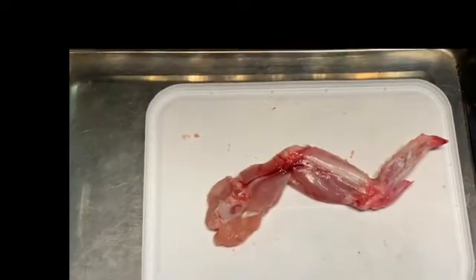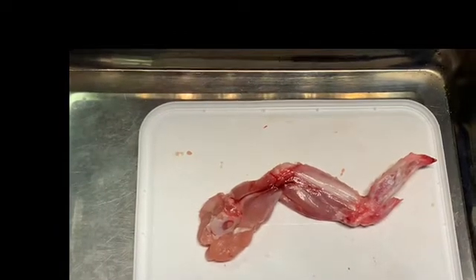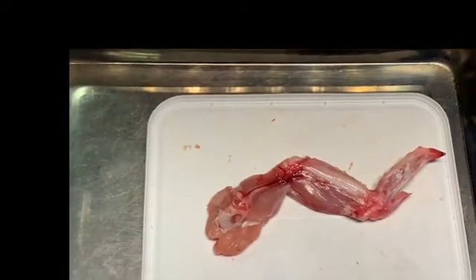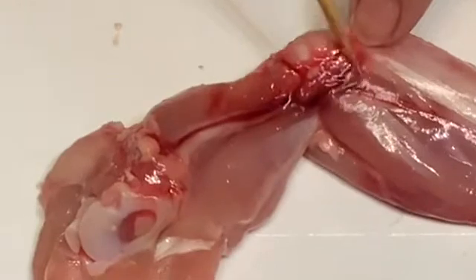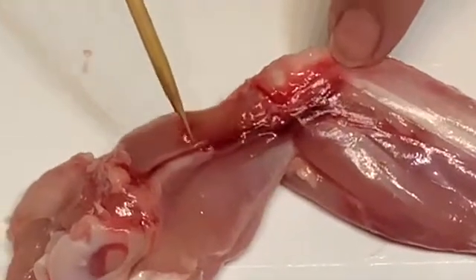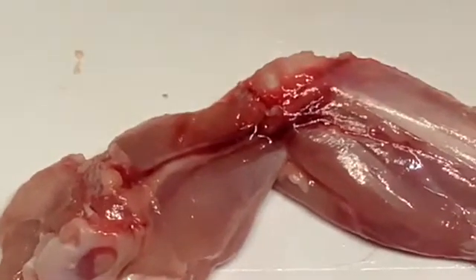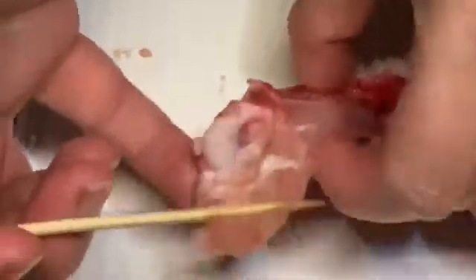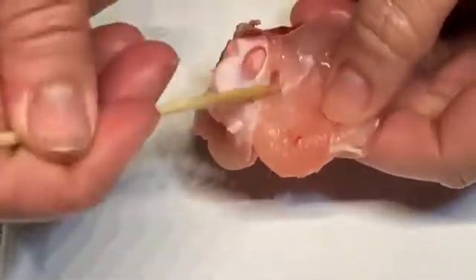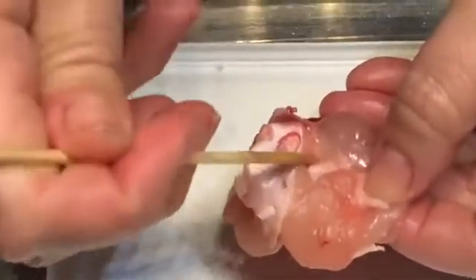You need to do a drawing of your dissection and label as many muscles, tendons, bones and other bits and pieces as you can find or see. Here you can see quite nicely that there is a blood vessel running along the leg, and then at a certain point it becomes very small and becomes capillaries inside the muscle tissue. If you look at this end, you can see there is a tendon connecting a muscle onto the bone, so that's attached to the muscle.